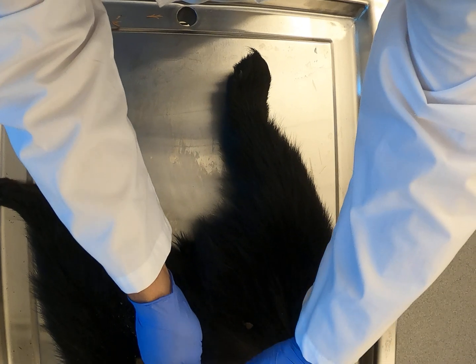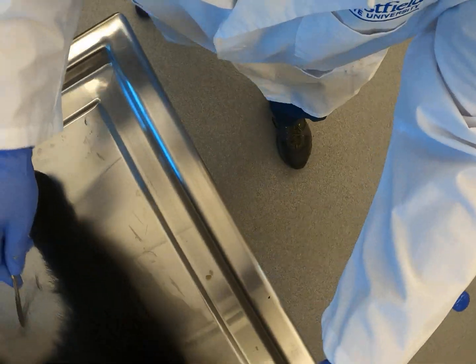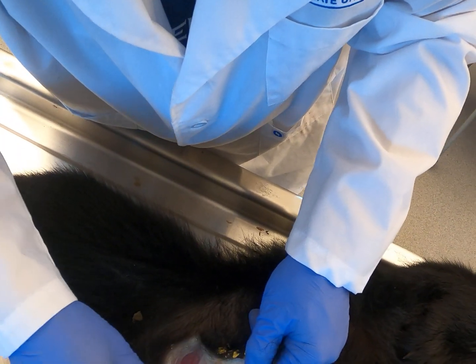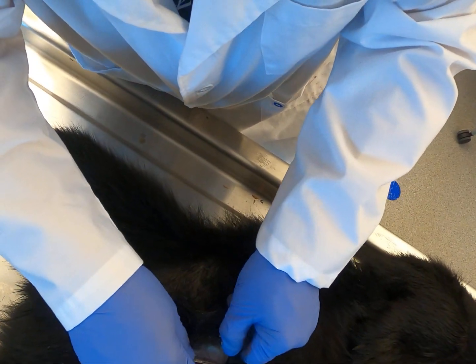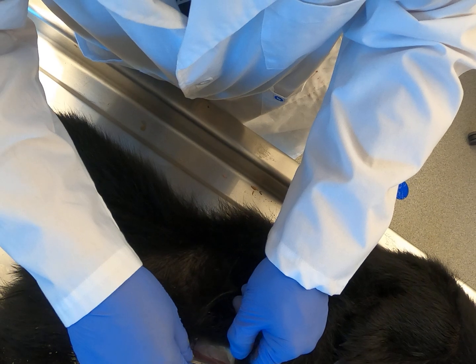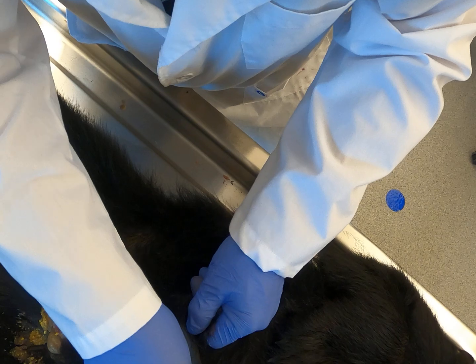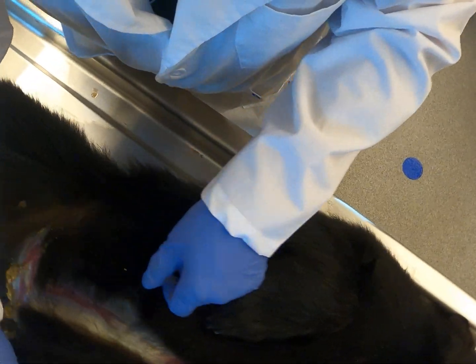She's thawed out — I had her thawing over the weekend. I'm going to cut up the middle through the hide. Notice how thick the hide is on this bear, even on a young bear like this — really thick skin and dense fur.